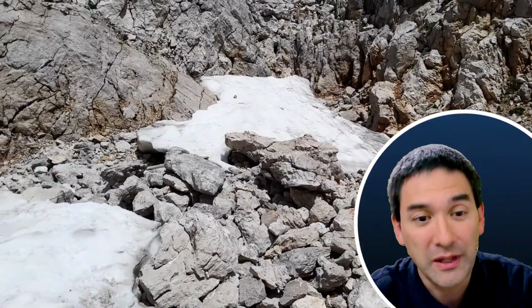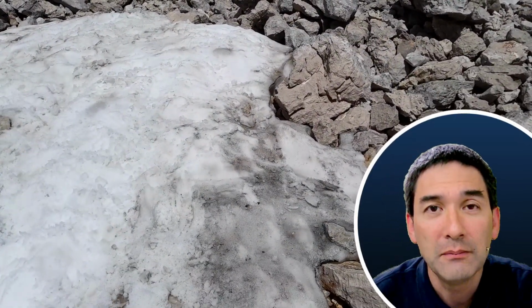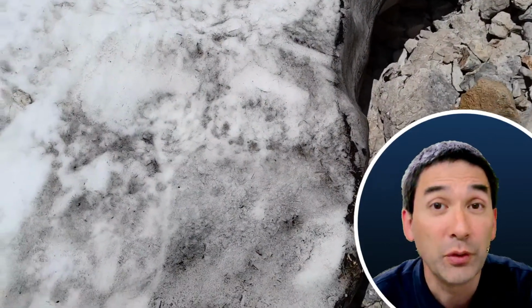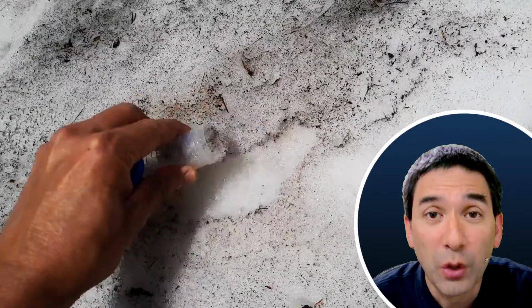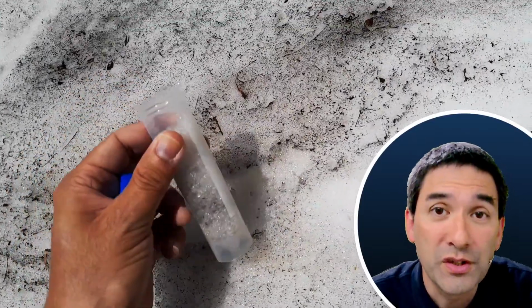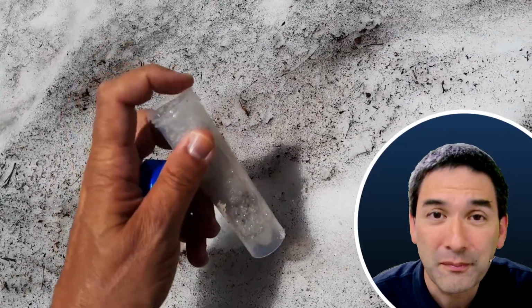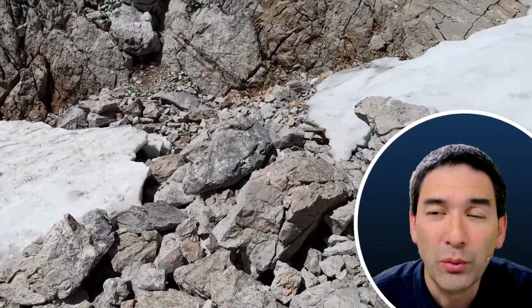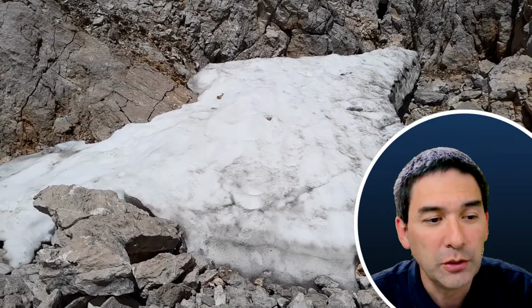What are we going to do here today? You can already see in the back of the video, I visited the mountains about 2.5 weeks ago, and even though it was quite a warm day, and it has been quite warm, interestingly enough, I could find several patches of snow there, some leftovers from winter, so it survived a couple of months. I simply collected a little bit of the snow, of the black material, and I've got it here, and I would like to put it under the microscope.